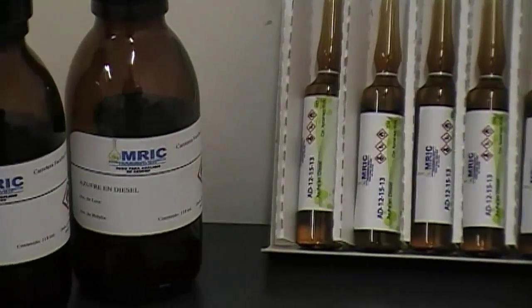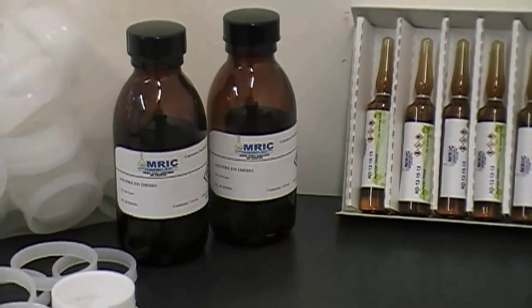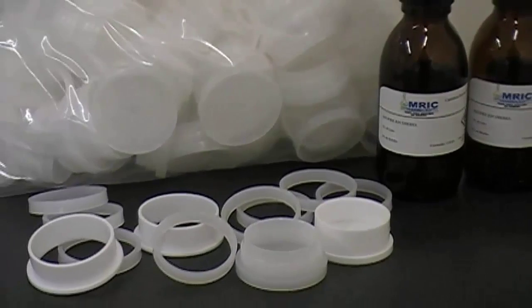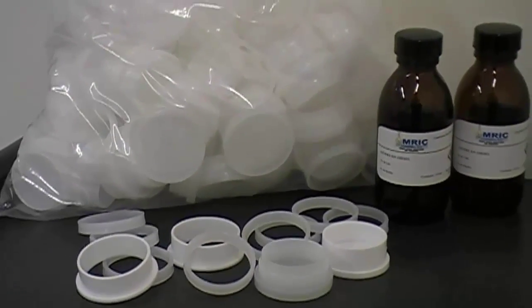Then we demonstrate the correct use for different ASTM methods for analysis of sulfur. Demonstration of how to use our materials.